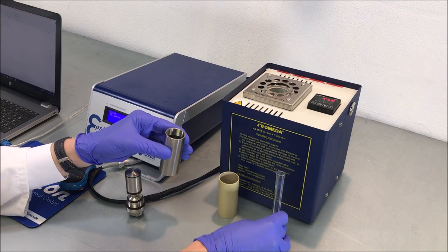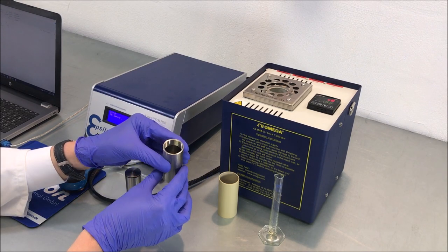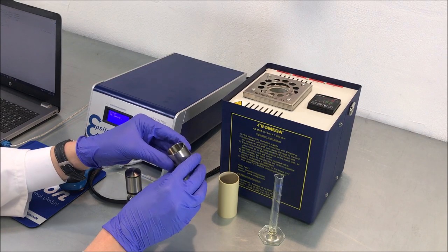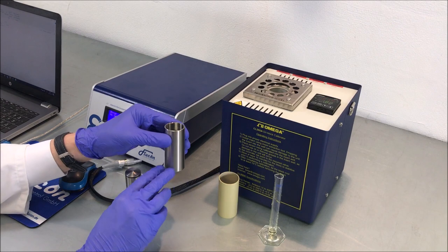Make sure that the cup is filled without dripping on its inner thread since this may affect the measurement. Turn the cup slowly to distribute the sample evenly.